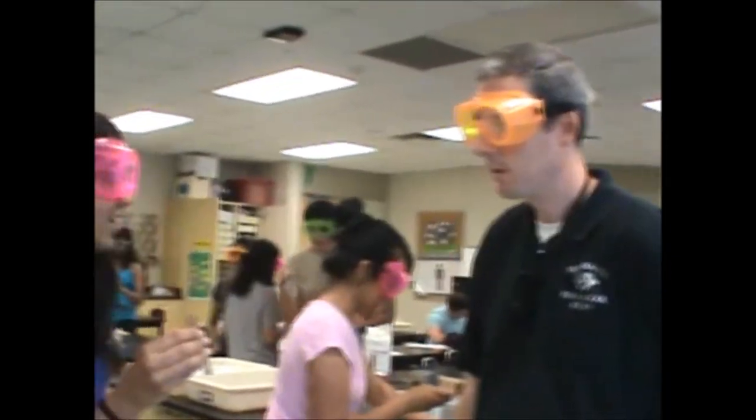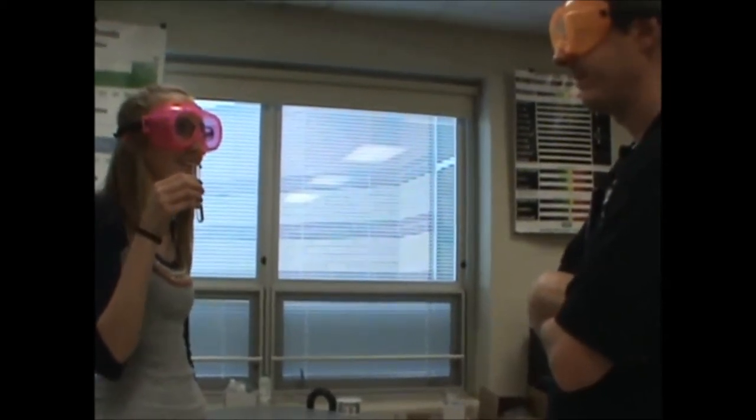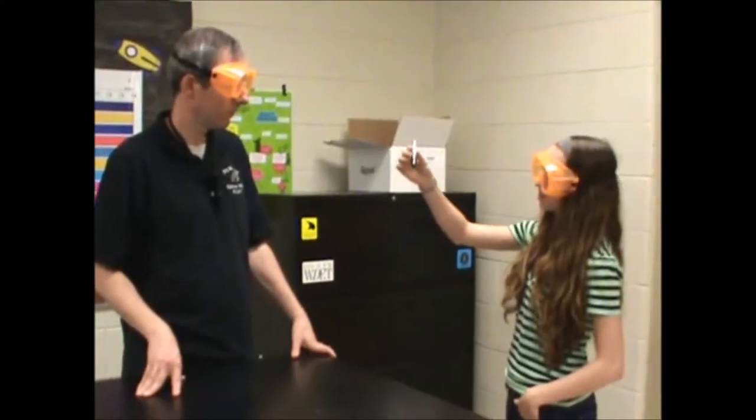Do you alter the smell of the unknowns? Why are you doing this? So is nitric acid a nitrate? Can you smell this for me? Is turquoise blue or green? What color do you say this is?